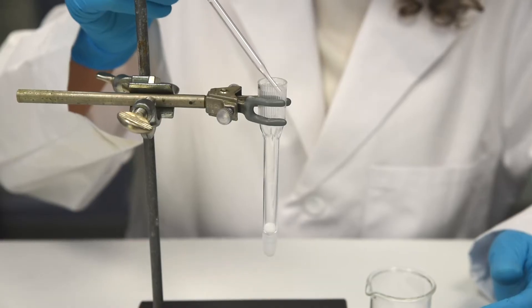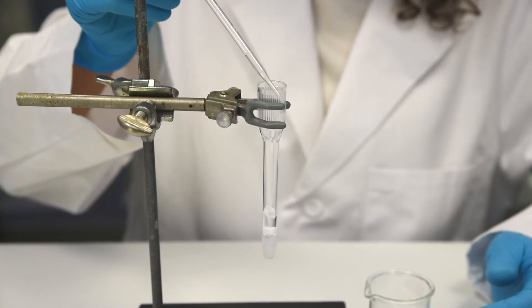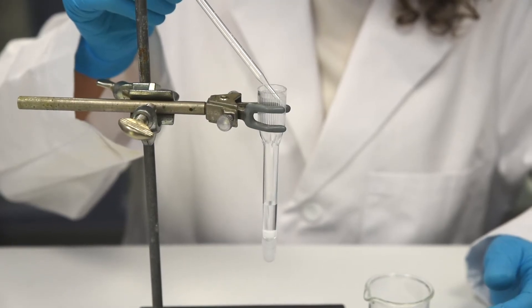Step 2: Add 1 ml of 1x elution buffer to the column and confirm that the bottom cap is sealed.